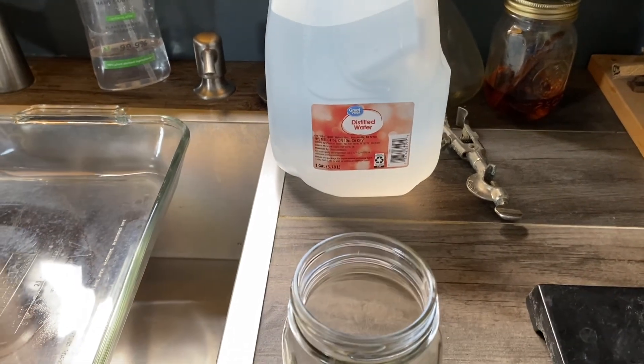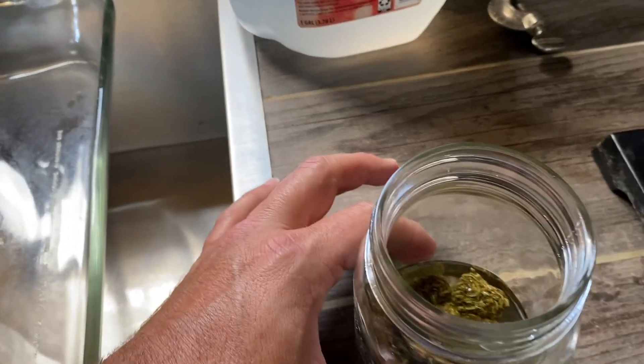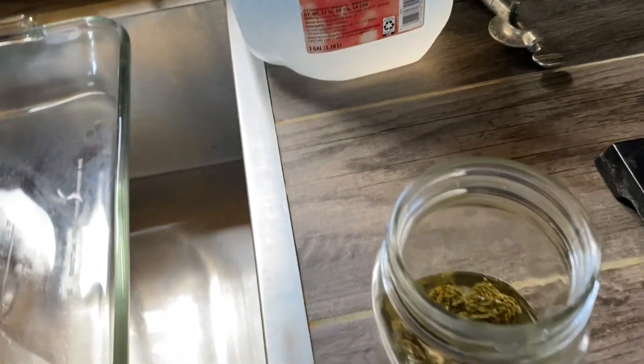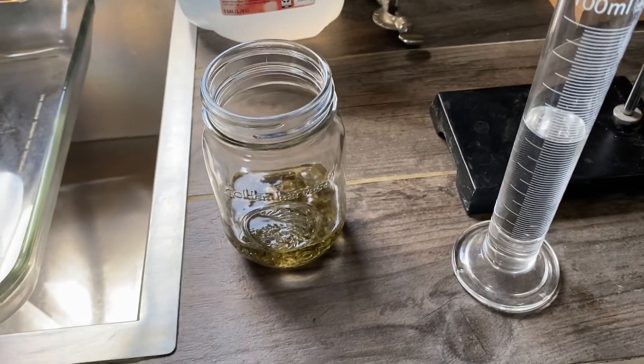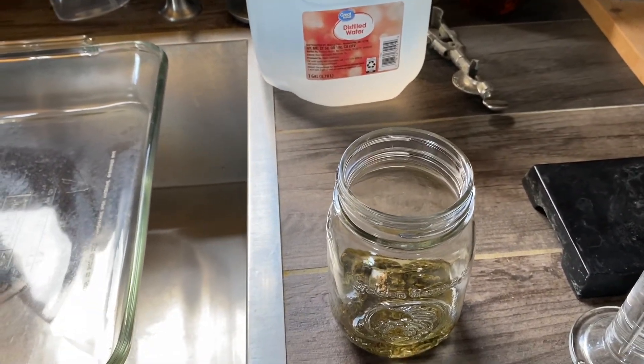Let's get a temperature while we're doing this. Now the trick of it is, this doesn't have to sit very long — we're only going to let it sit there for about a minute. We're going to take our ethanol — let's check the temperature.